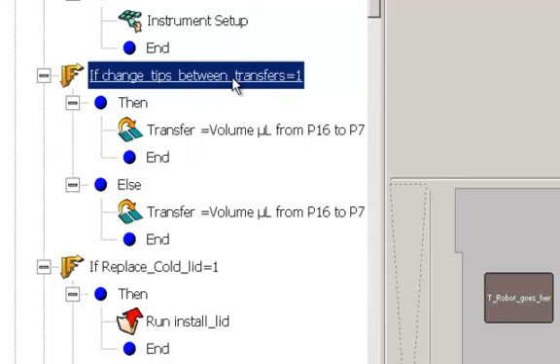And I mentioned earlier that if we use 500 microliter tubes and 2 mL tubes, if you're setting it up where you don't have that hardware and you're going to use a PCR plate, this is really the only place, this procedure is the only thing you're going to have to change in the method. You're going to have to set it up to use your PCR plate as your source plate. It shouldn't be that difficult.